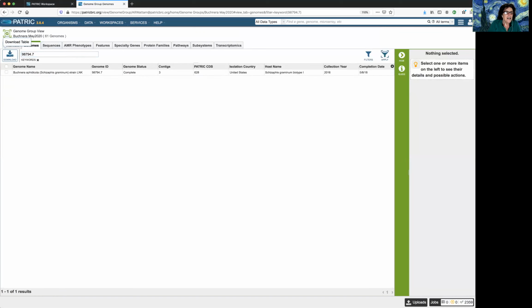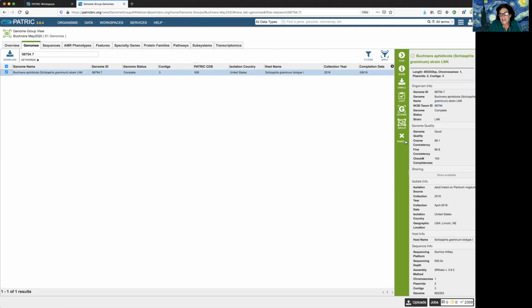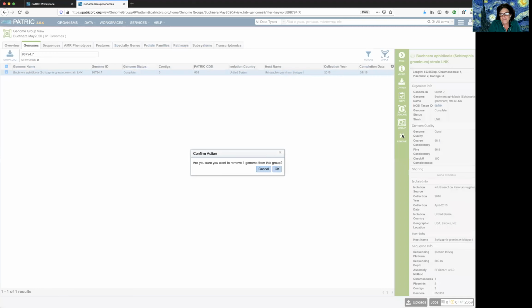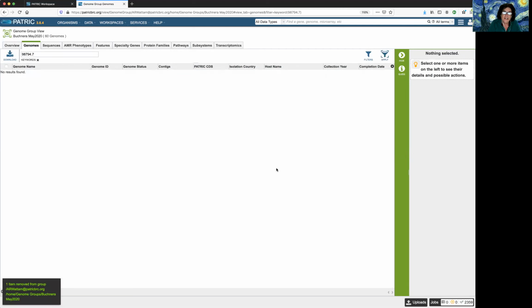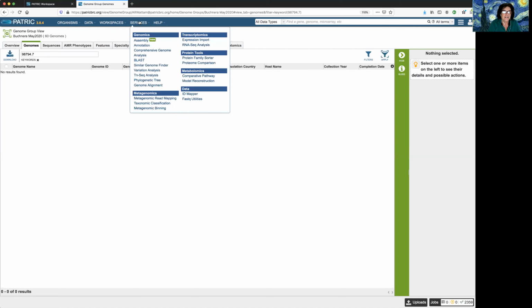Did I get it all? Ah, yes. These genomes. Okay, click on that. And then remove it. Okay. So now I should be able to launch a tree job with these new groups, and it should look a lot better. And as a matter of fact, I have done that. So I'm going to show you when I removed all of these. I'll just step you through it like we're doing it again.